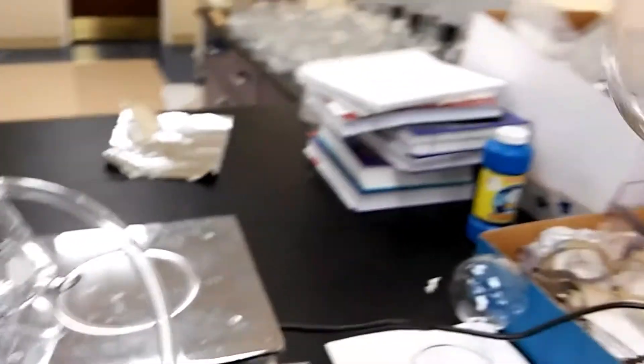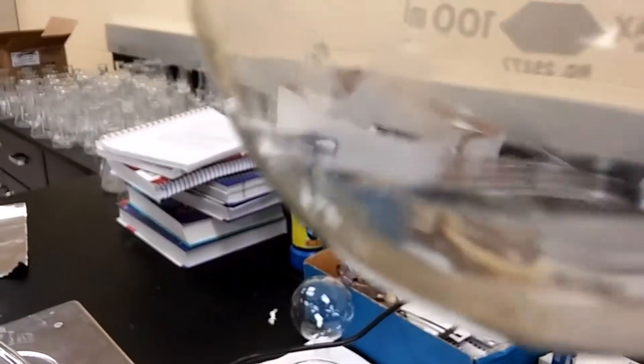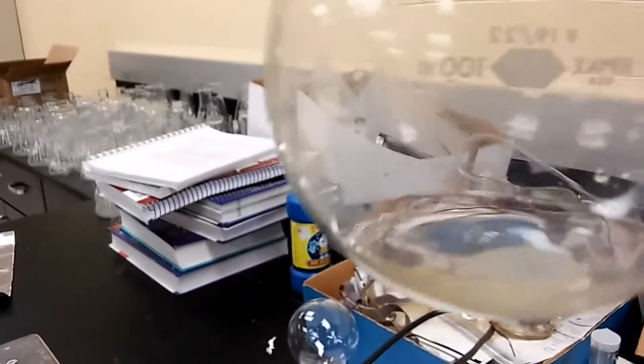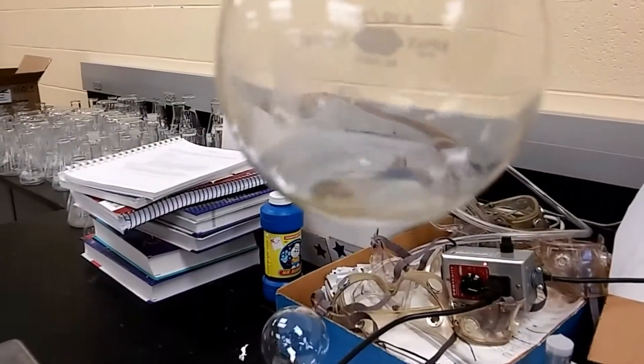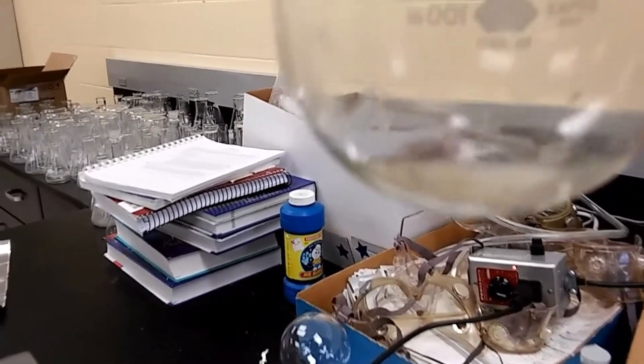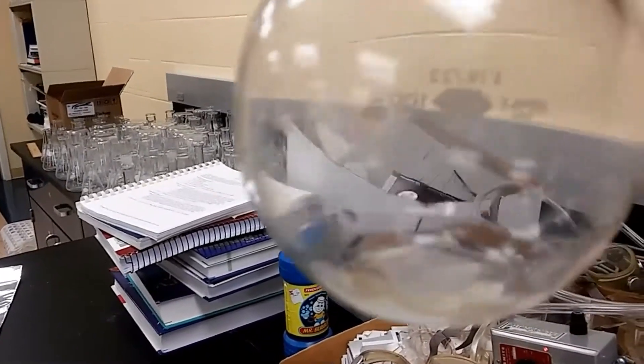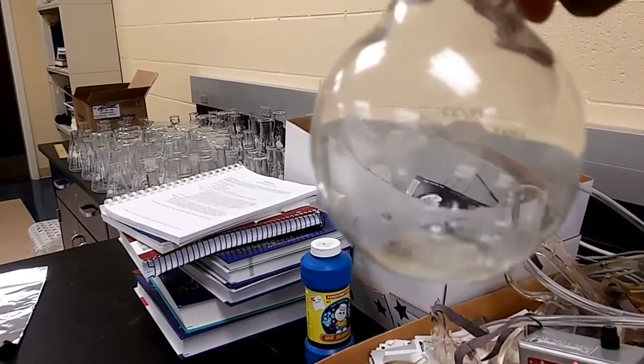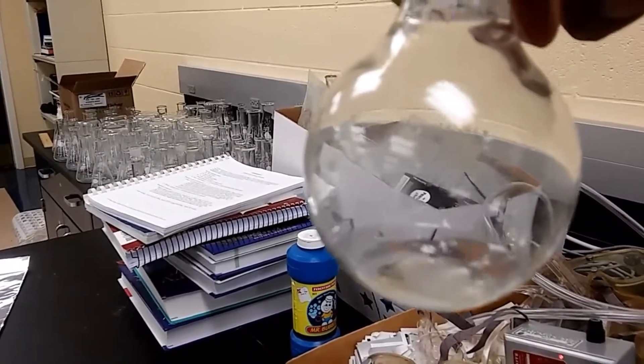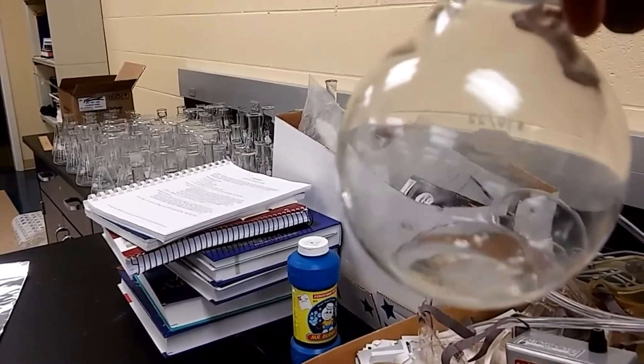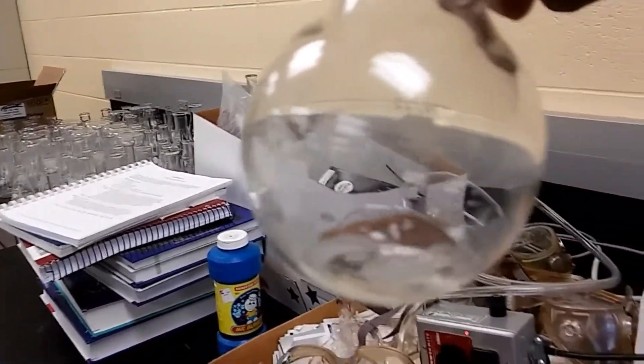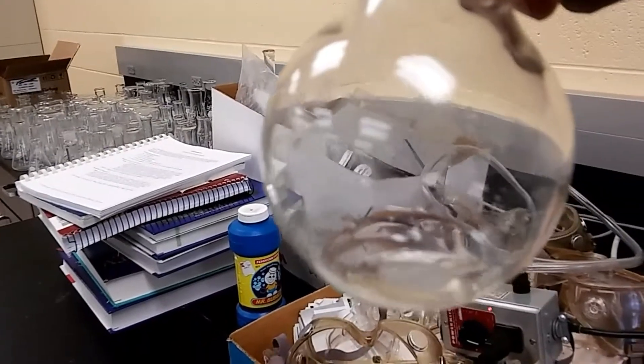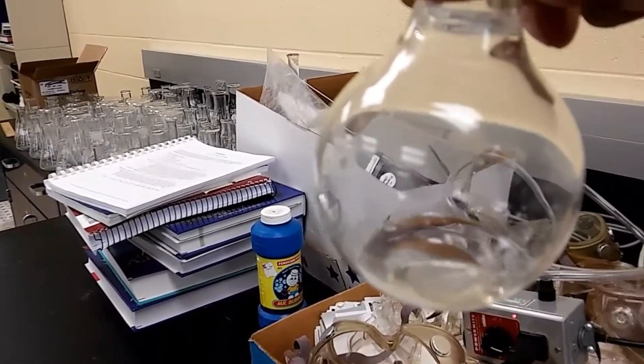We do know that we are collecting our product. I transferred some of the drain liquid into this flask here because I'm going to distill it. You can see some murky liquid. I guess the camera is really not picking up, but there is a clear white liquid on the bottom. I'm sure that will come off when you distill it. That's the current status of the process. I will catch you up when I'm ready to go to the next step. You can see that white liquid in there? That's impurity. It's the clear liquid that's the phenol. So we're going to have to distill it again. Depending on time, we may do it in this lab period or the next lab period.